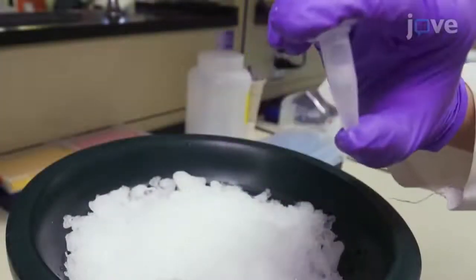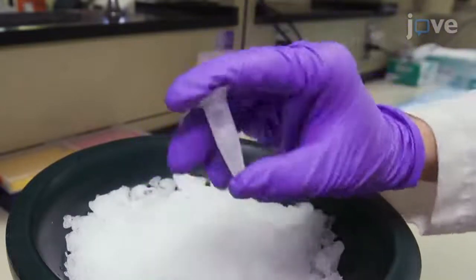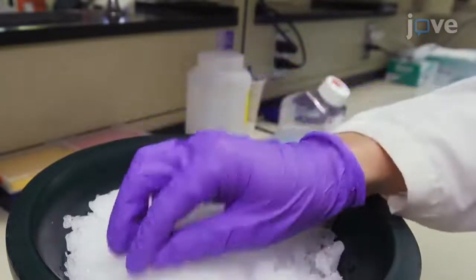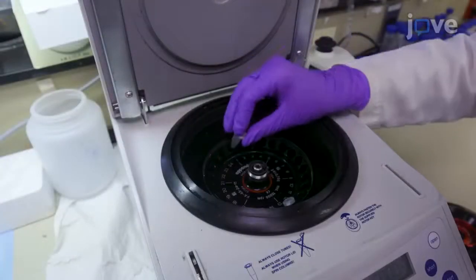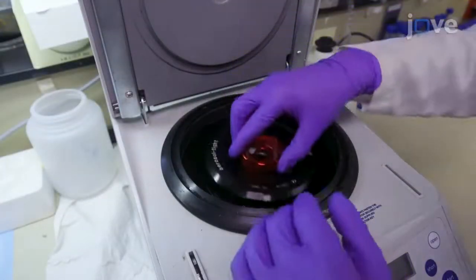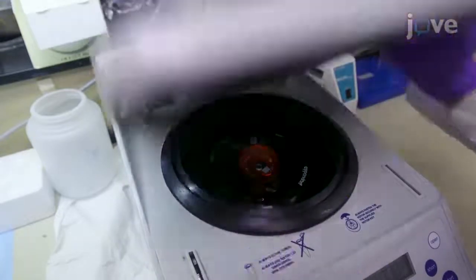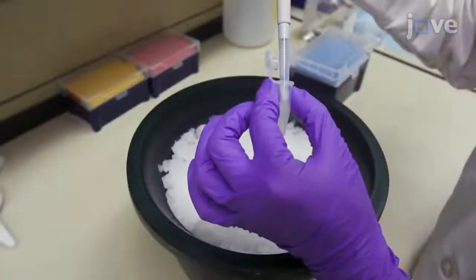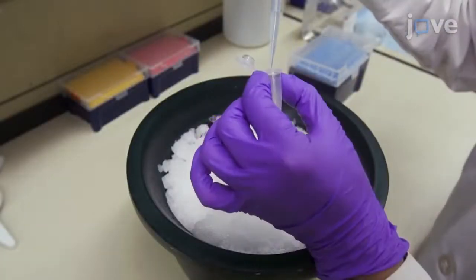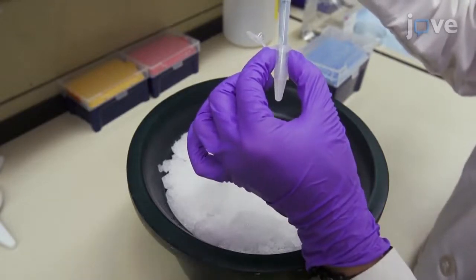Invert to mix the lysis buffer and lysing cells well and incubate the tube on ice for 10 minutes. Centrifuge the tube at 18,000 times G for 10 minutes at 4 degrees Celsius. Transfer the supernatant into a new 1.5-milliliter tube and keep chilled on ice.